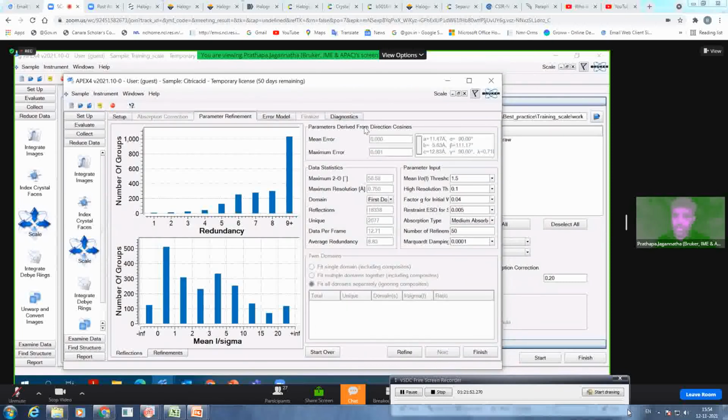Here you get the diffractometer parameters. Here you get the data statistics. You get the reflection statistics here, and then the parameter you want to modify for the scaling, or how you do the scaling. Depending on your scattering factors, like what elements you have used and what's the size of your crystal, you can choose whether strong, medium, weak, or no absorption. Also, you can adjust the restraint for ESD for scale factors as well. So let it run for the first time because you don't know how the data is.